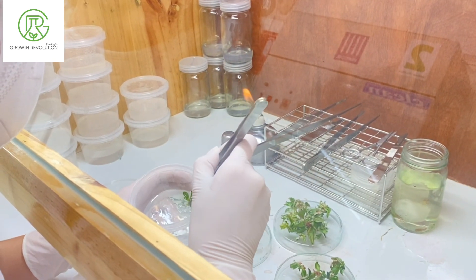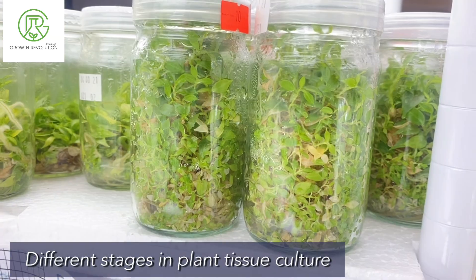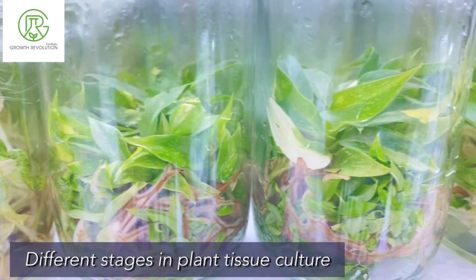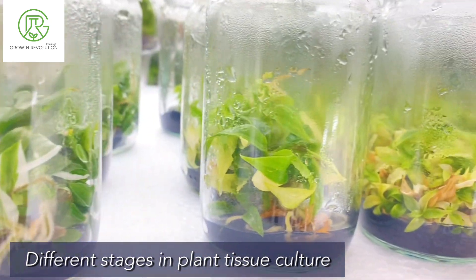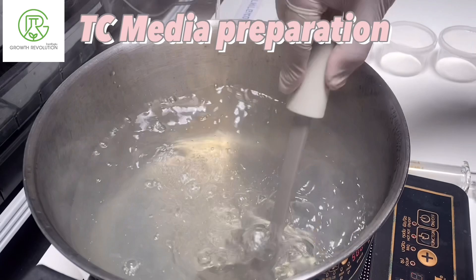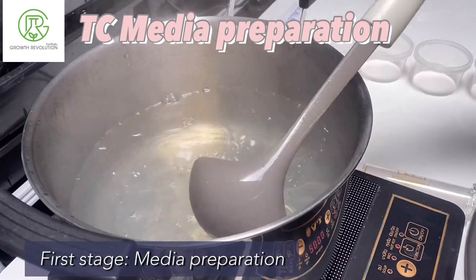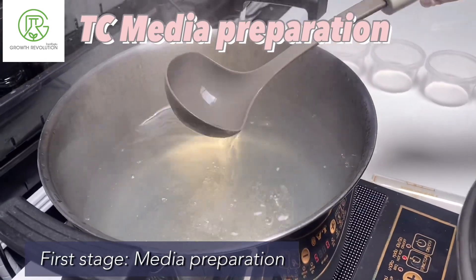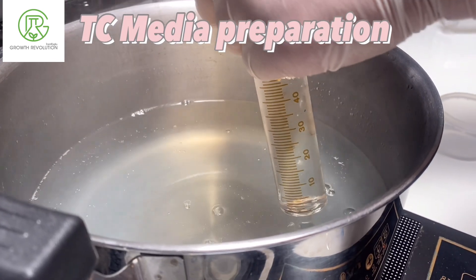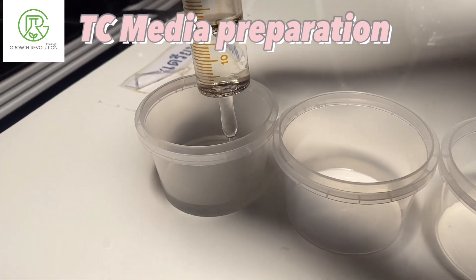Hello, what's up everybody! Today I'm going to take you through different stages in plant tissue culture. The first stage is media preparation. In this stage we will make two different media: the media for the multiplication stage and the media for the rooting stage.